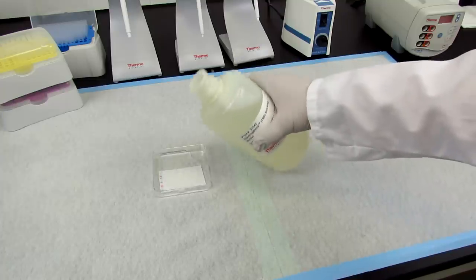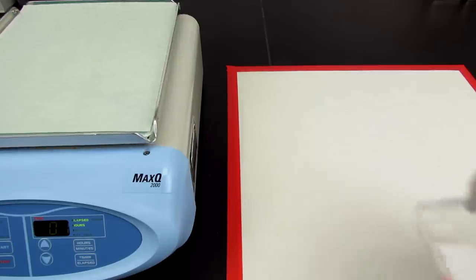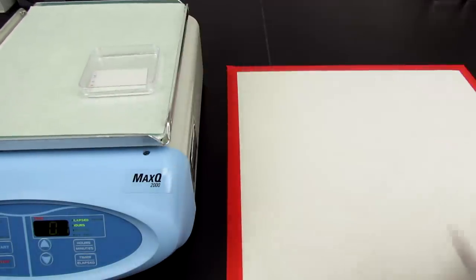To block your membrane, immerse it in a blocking buffer for 1 to 2 hours at room temperature or overnight in the cold room.